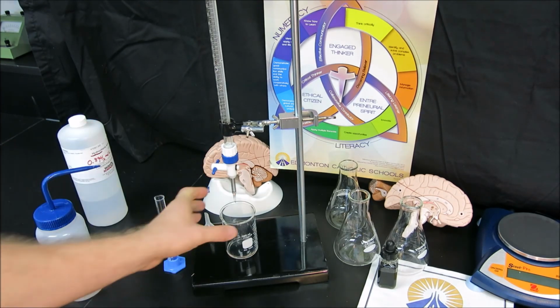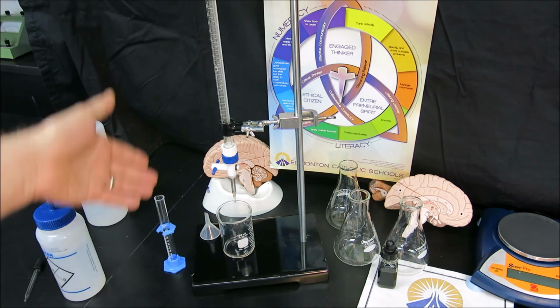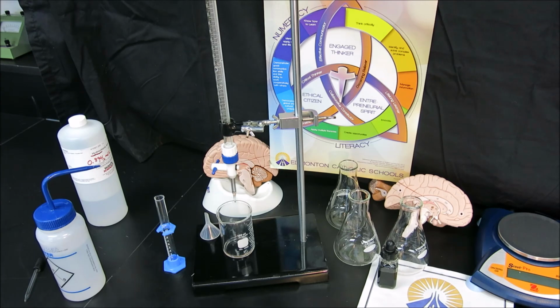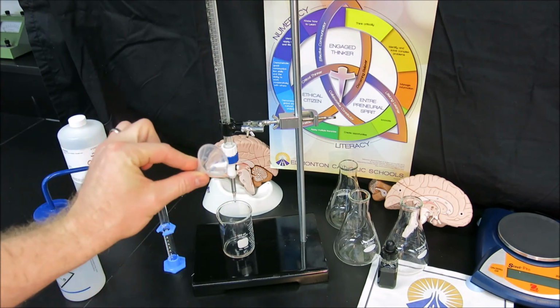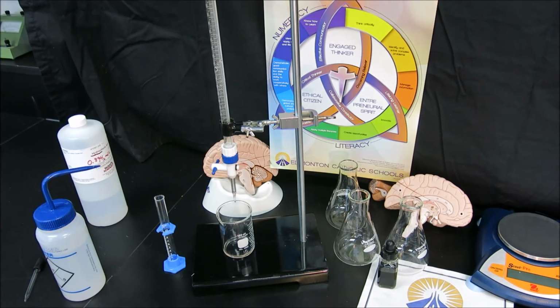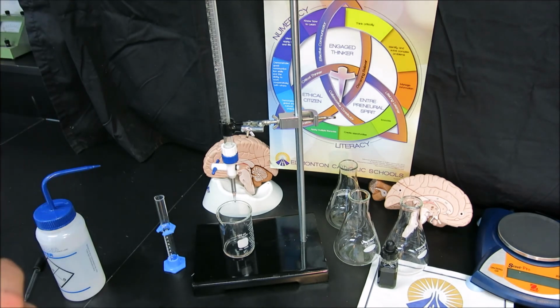We have rinsed with water, but unfortunately if I went ahead now and filled this with acid and then titrated, the first bit of acid is going to be diluted from the water that's left in the burette. So before we do that, we need a rinse with our titrant, which is our acid, and I'll use a tiny little burette funnel, place it in the top of the burette, and we'll fill it with a little bit of acid to do a rinse.